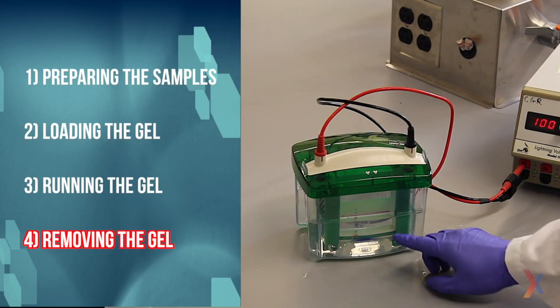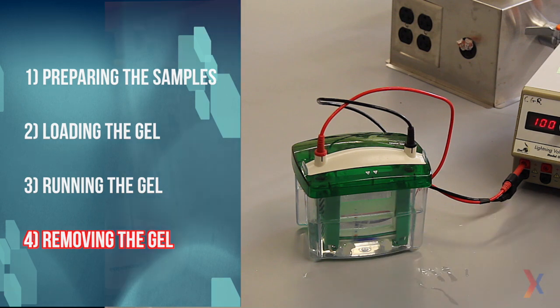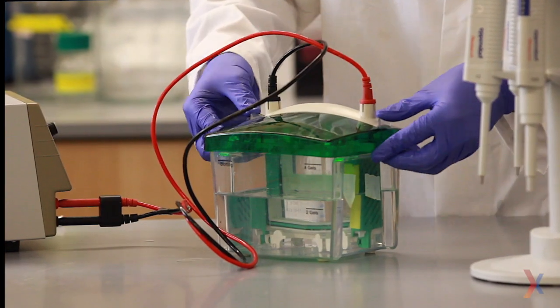This gel has now been running for one hour and the loading dye has made its way toward the bottom of the gel, so it's time to take it out. Hit stop.